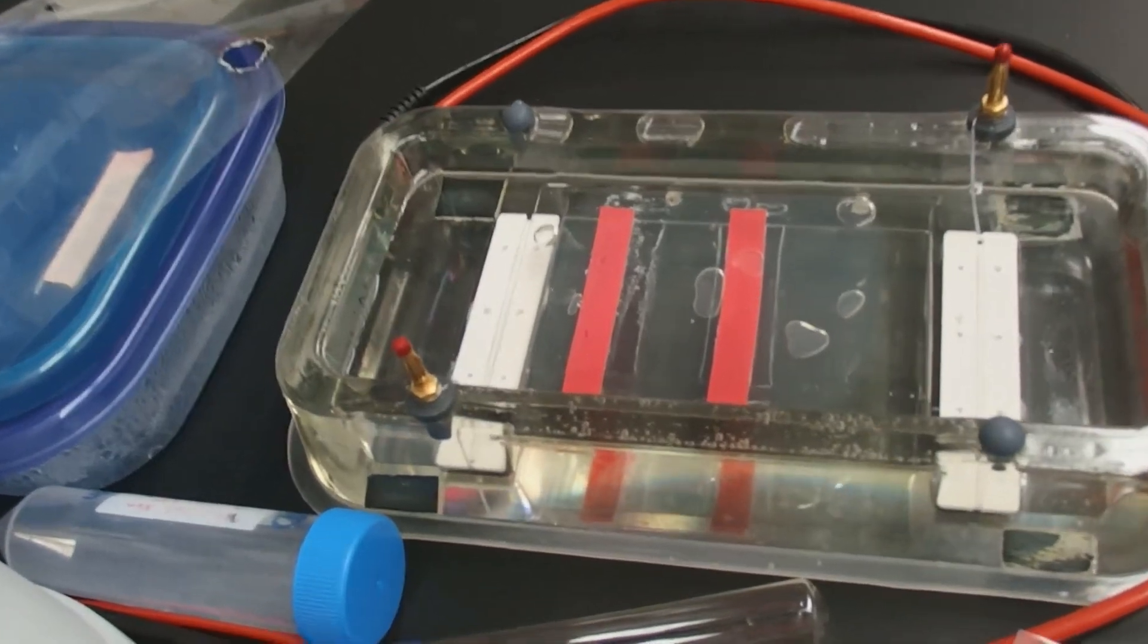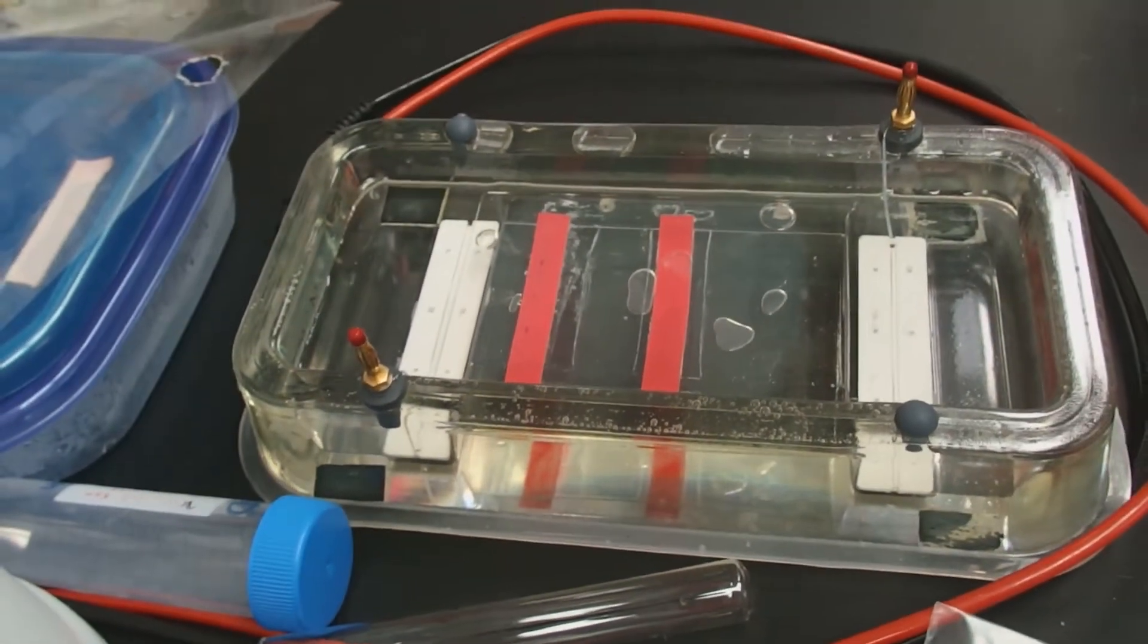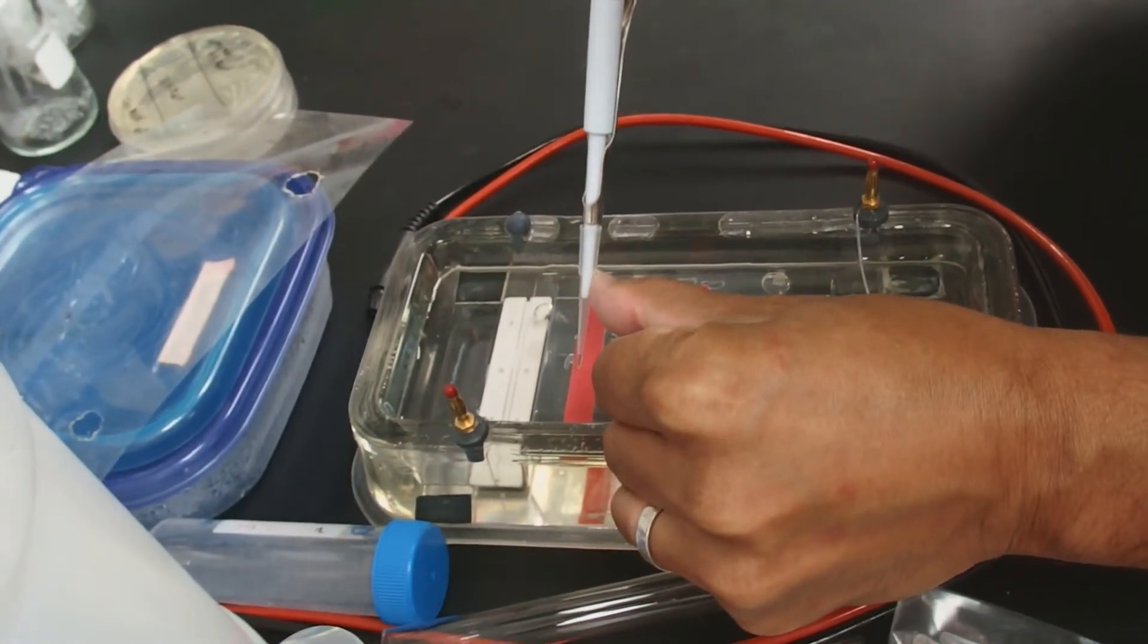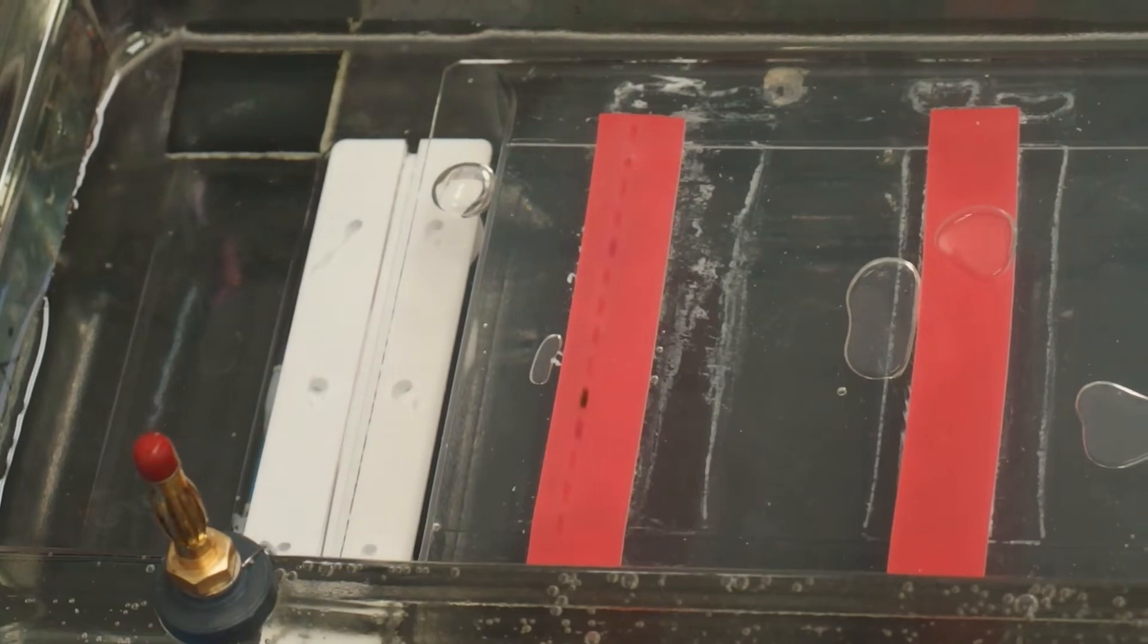I'm going to load two microliters of these digests that I have. It's good to stabilize your hands by resting your hand gently on the edge of the box.